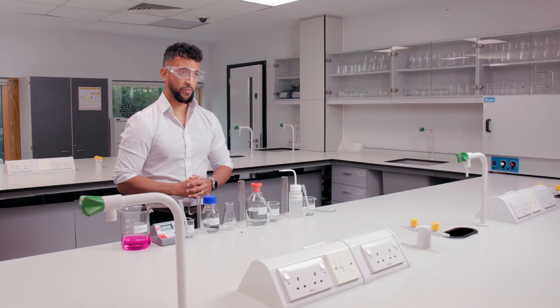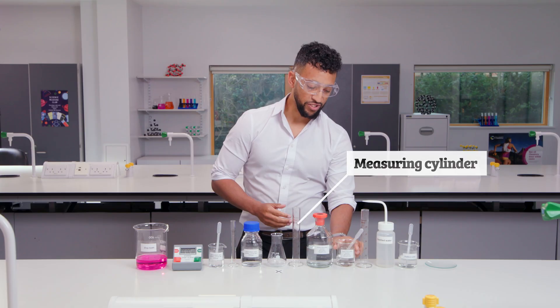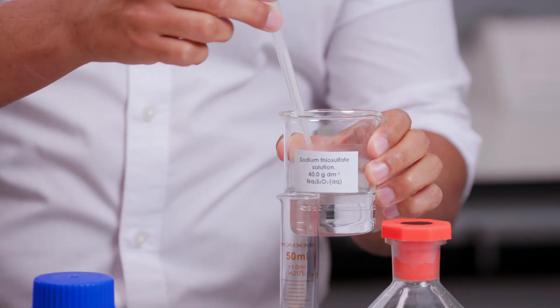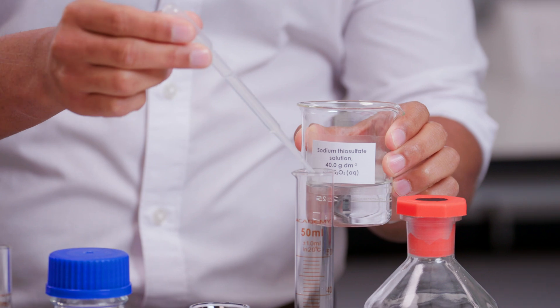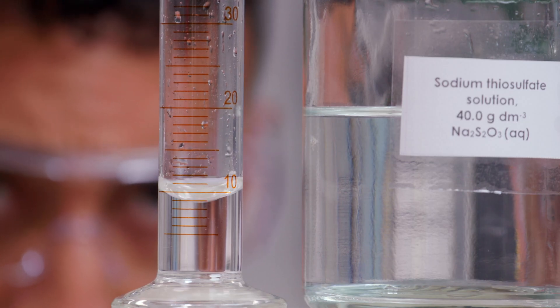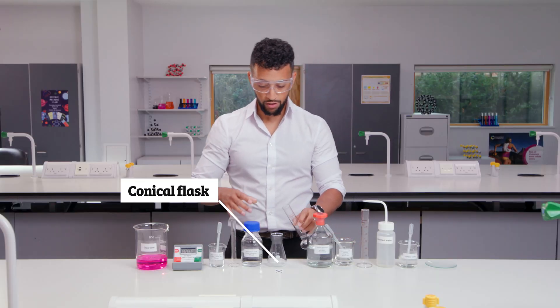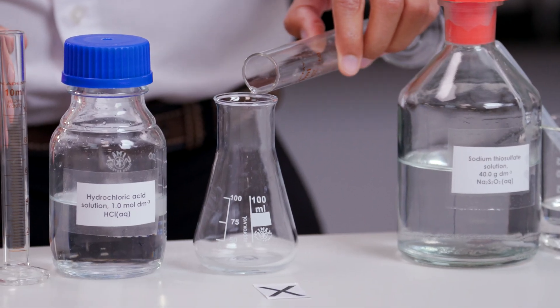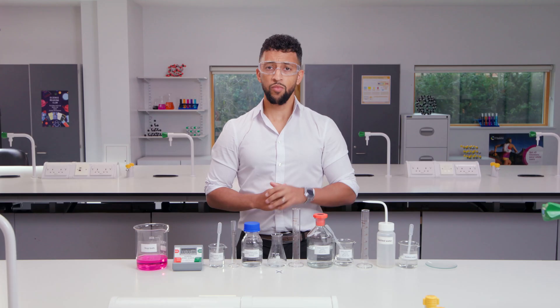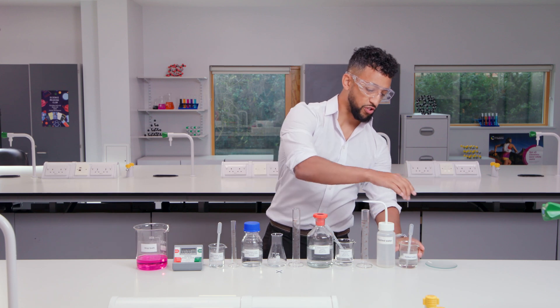Let's start with our first concentration A. Using a measuring cylinder, measure 10 centimeters cubed of sodium thiosulfate solution and then pour it into the conical flask. Next, measure 40 centimeters cubed of distilled water.